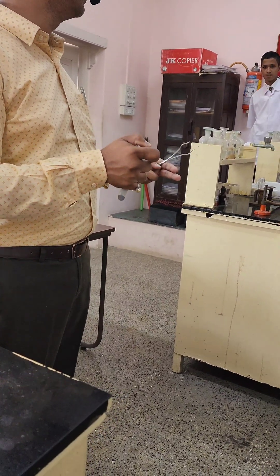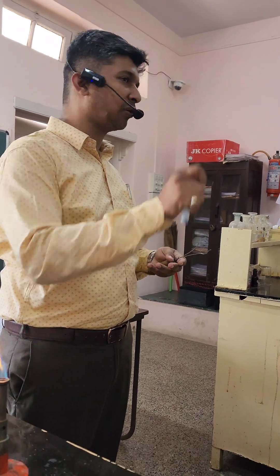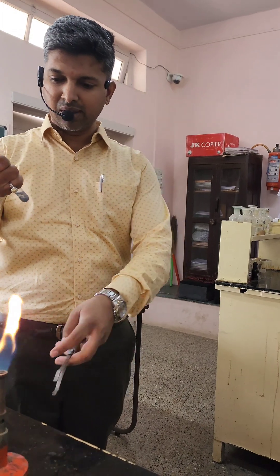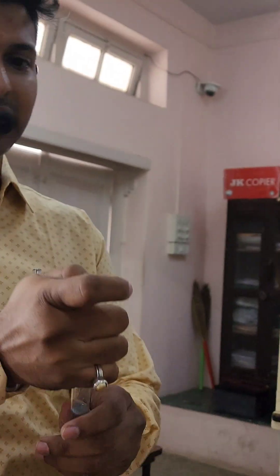The HCl is corrosive, but it did not burst and the fingers would not get burnt because it is not concentrated. I am doing this, and still you can see some bubbles of hydrogen gas being formed at the surface of the liquid.